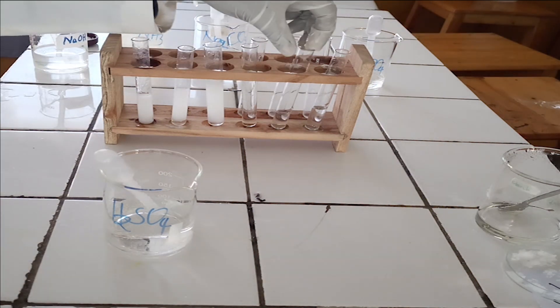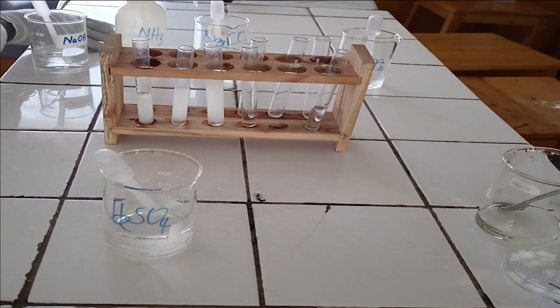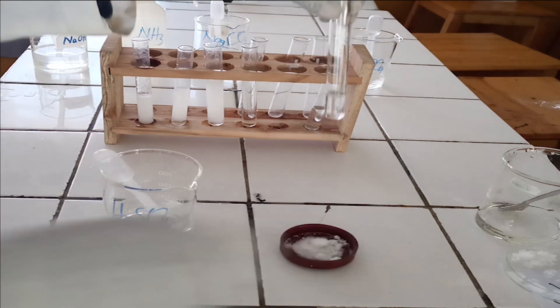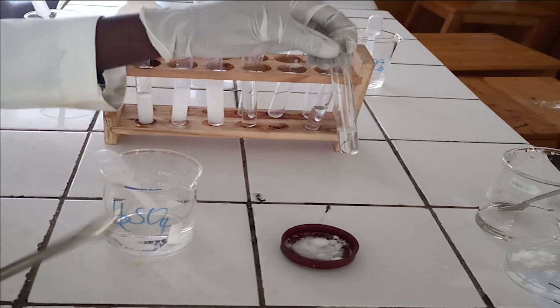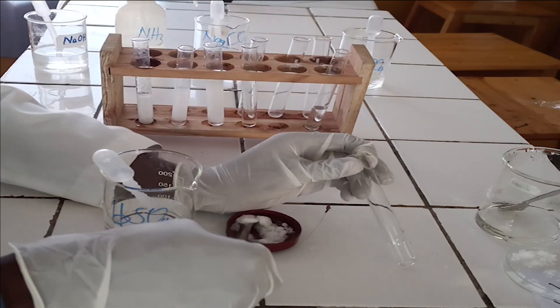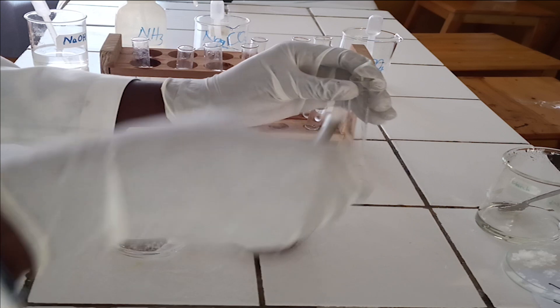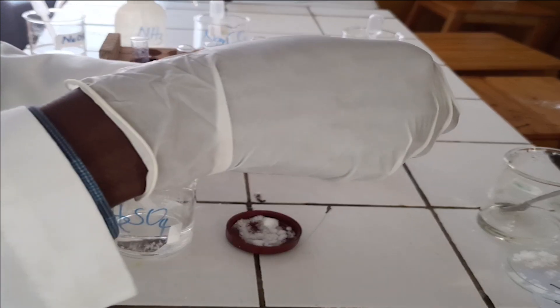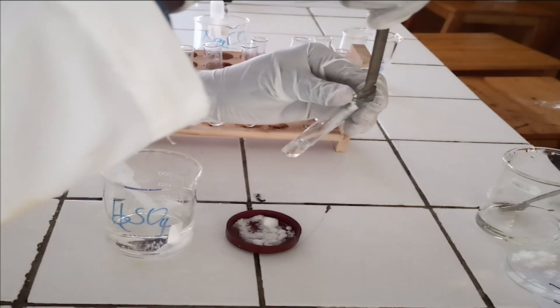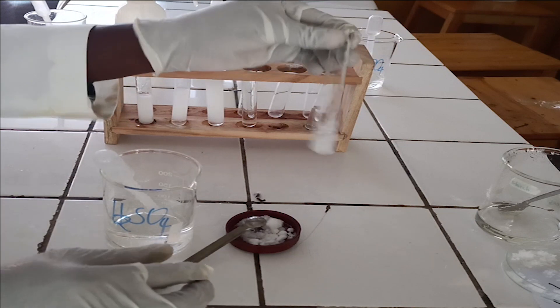Confirmatory test. To the fifth test tube, add solid ammonium chloride followed by four drops of disodium hydrogen phosphate, and then add ammonia solution dropwise until in excess.